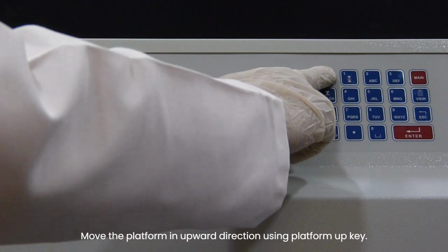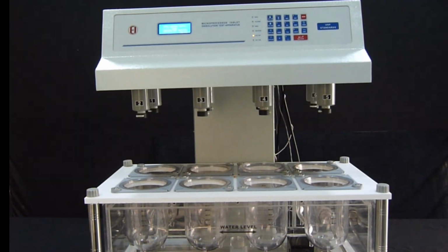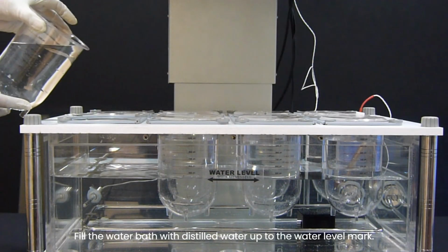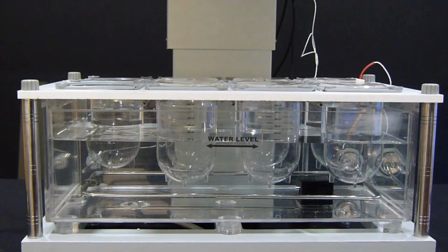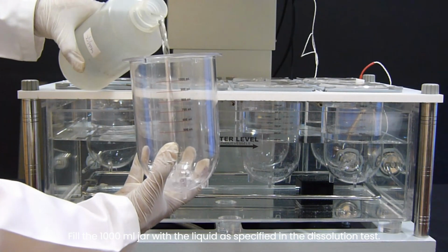Move the platform in upward direction using platform up key. Fill the water bath with distilled water up to the water level mark. Fill the 1000 ml jar with the liquid as specified in the dissolution test.